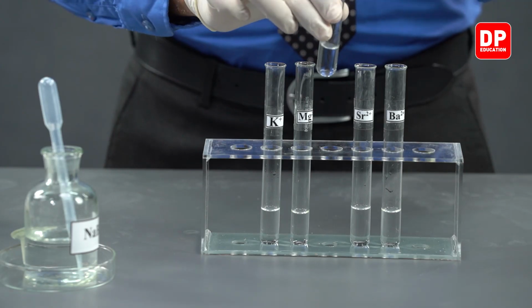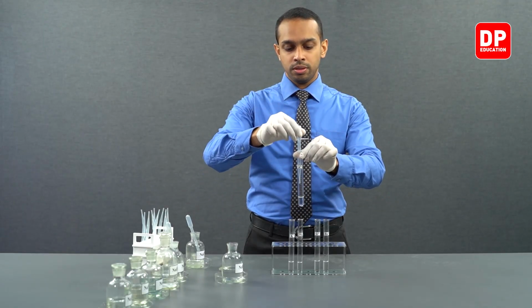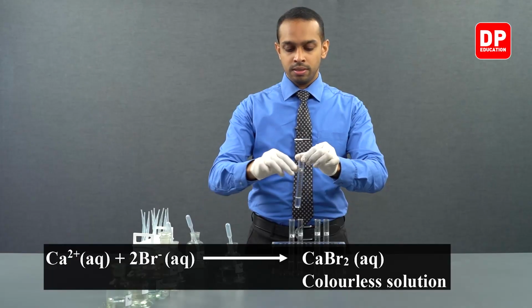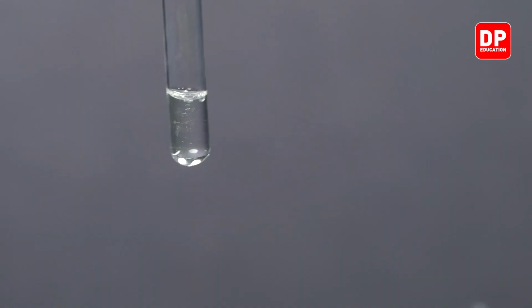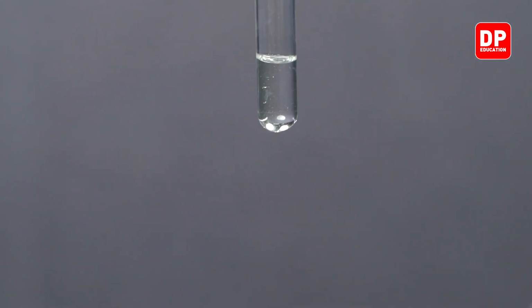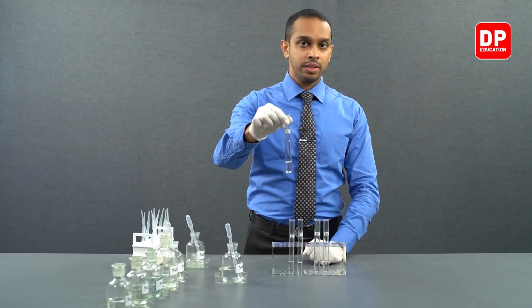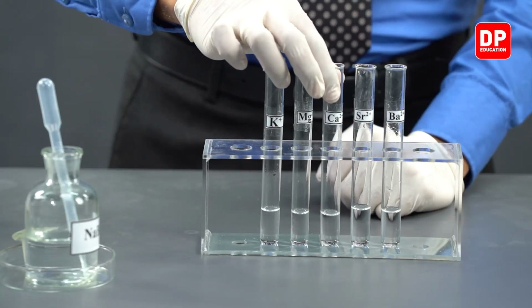We have our calcium 2+ ions. Let's add a small amount of bromide ions into calcium 2+ ions. Again, calcium 2+ ions, when reacted with bromide ions, form calcium bromide. This is also soluble in water and will not form a precipitate.